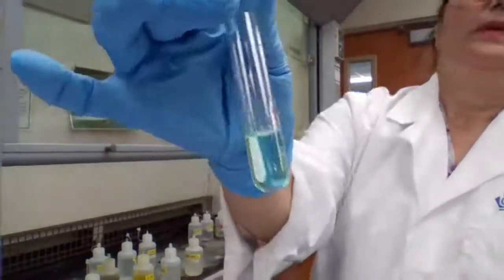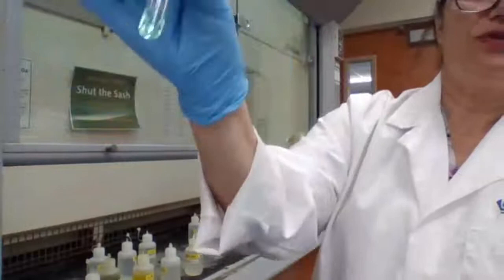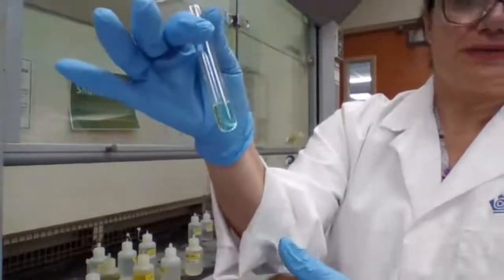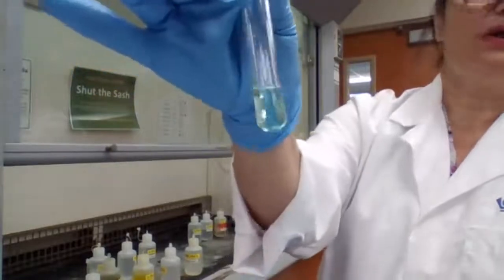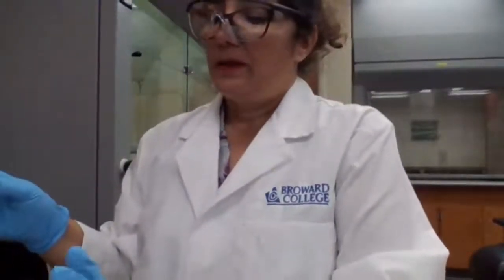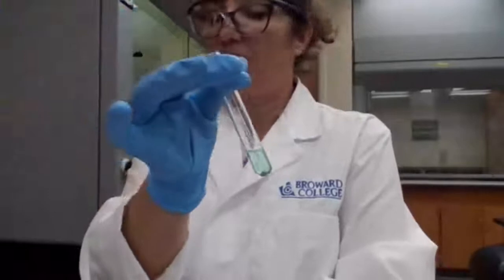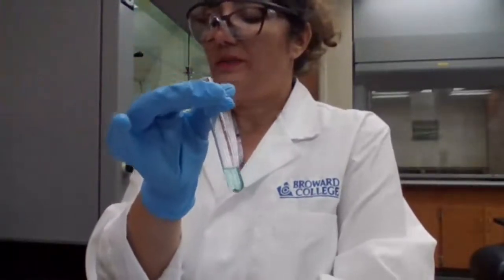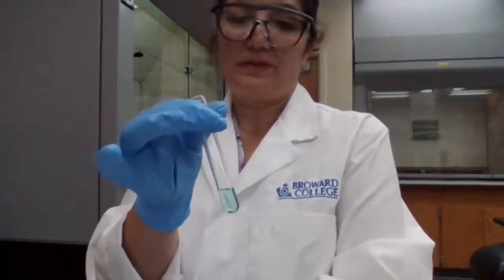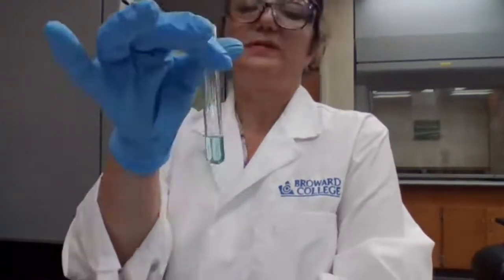So, there is no precipitate, it's all clear. There is no lead. If I had precipitate, I would centrifuge and separate it because I don't want lead sulfate to stay there. Because it's a clear solution, that means there is no lead sulfate. Now, we are moving to part 2B, where we want to separate the bismuth hydroxide.